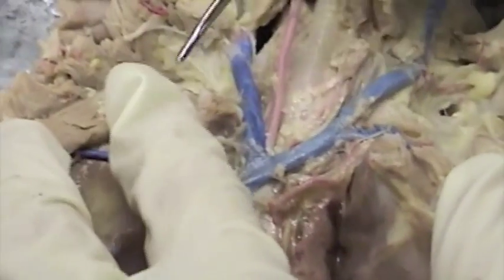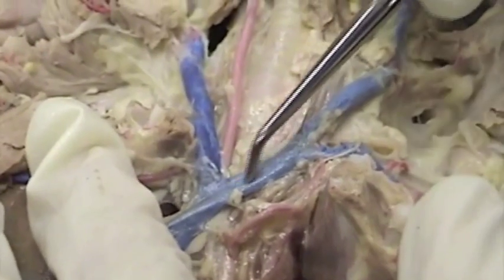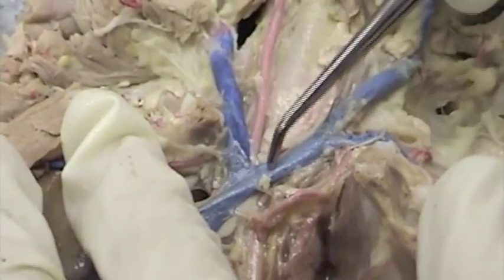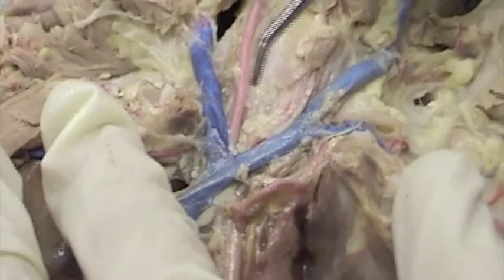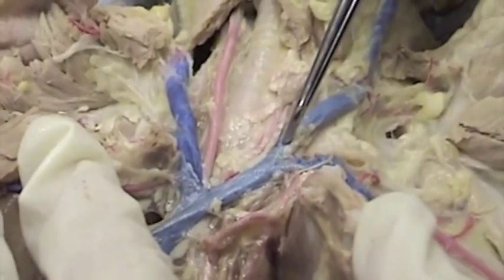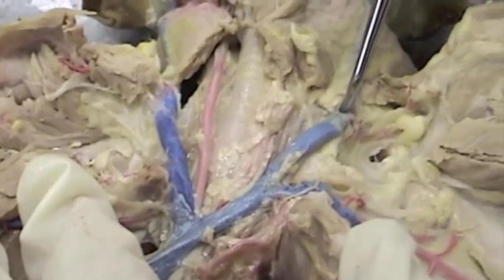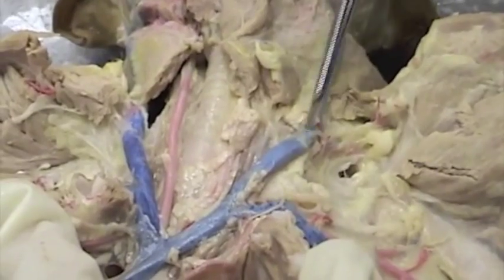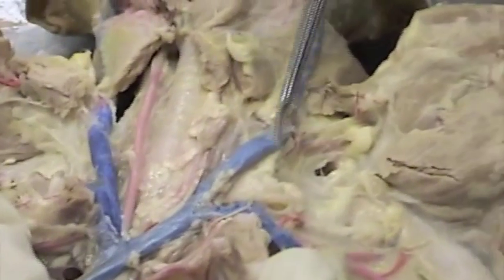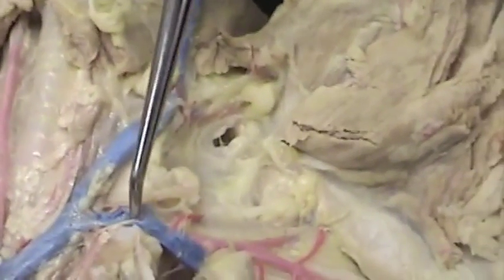We come up a little further at the branch. We find the brachiocephalic vein, one on each side, left, right. It is brachiocephalic until it divides. It divides into, first, external jugular vein in the cat. The large one is the external jugular, and subclavian vein.